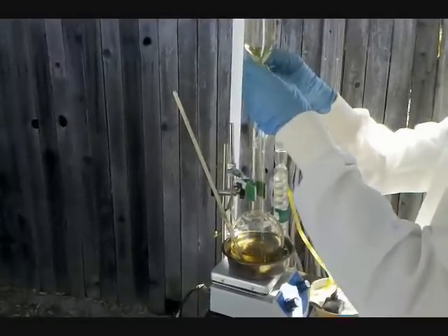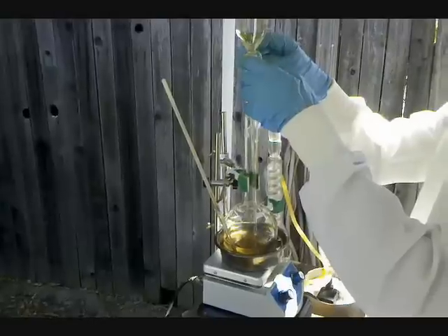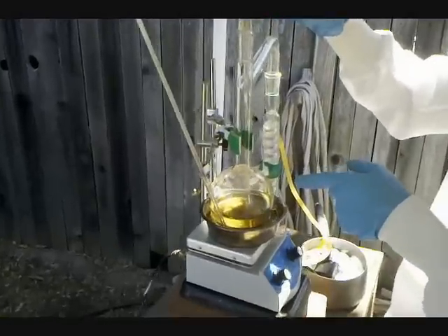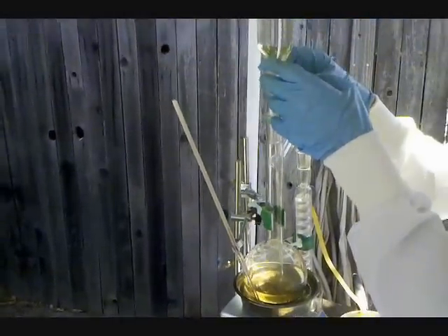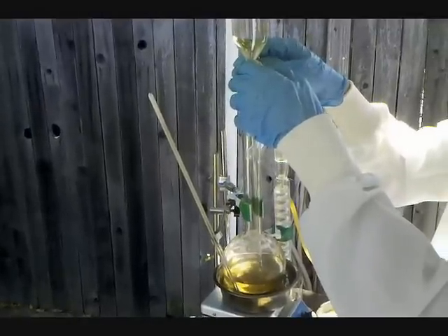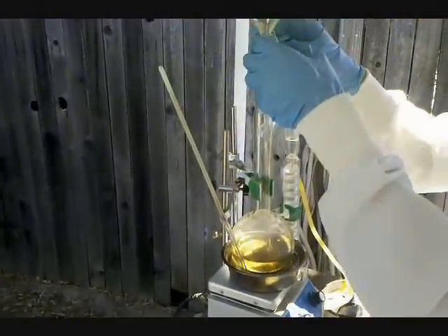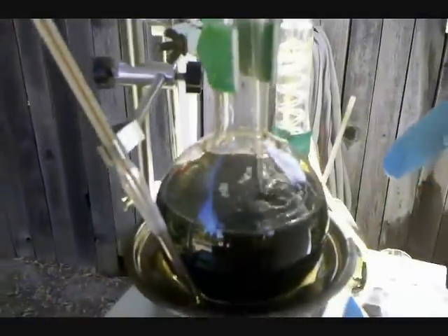The bath will change colors to become a little bit darker due to some oxidation reduction side reactions. If you look closely, you can see the ethanol being added to the sulfuric acid. I'm going to finish adding the ethanol and heat the reaction vessel up to the appropriate temperature, and then start adding more room temperature ethyl alcohol to make ether. Now if you look closely at the reaction, you can see it appears to be off-gassing a little bit. It turned very dark black and boiling kind of unpredictably, so be sure to be careful in adding it.